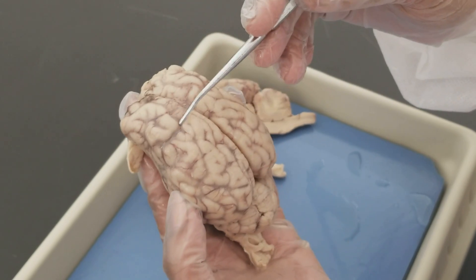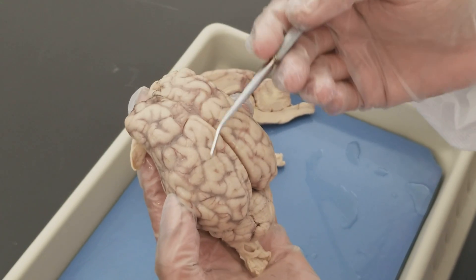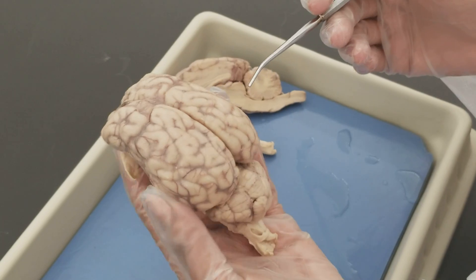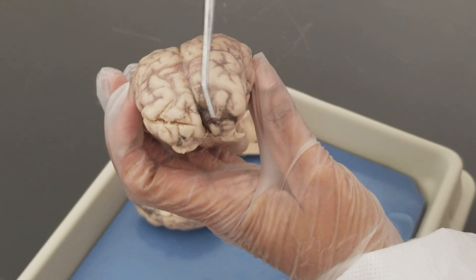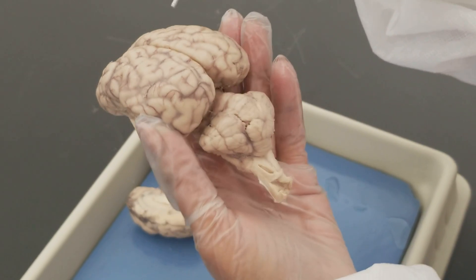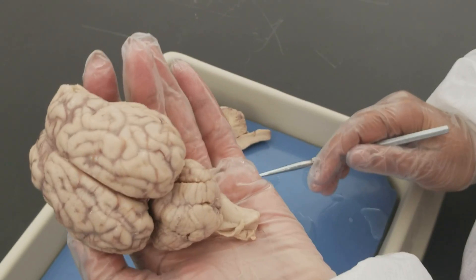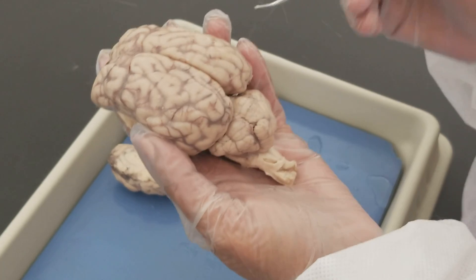There is also the central sulcus that separates the frontal lobe from the parietal lobe — not very distinct but you can kind of see it. The cerebrum is divided into lobes: you can see here the left and right frontal lobe, the left and right parietal lobe, the left and right occipital lobe, and the left and right temporal lobe.